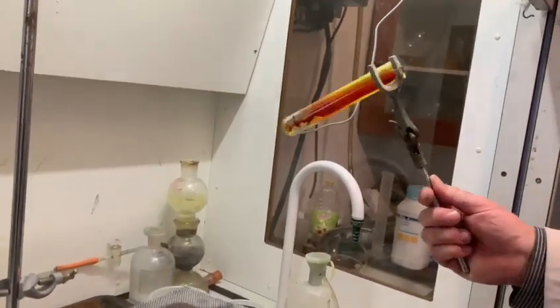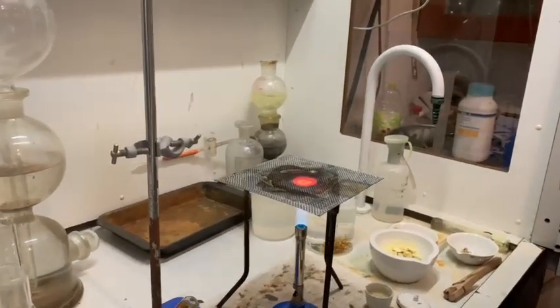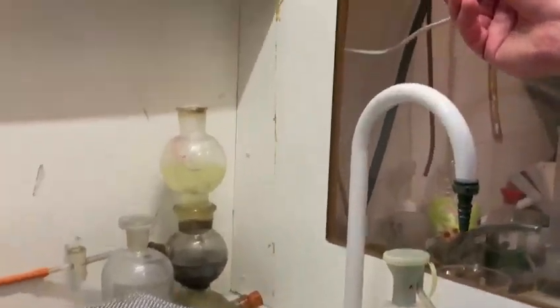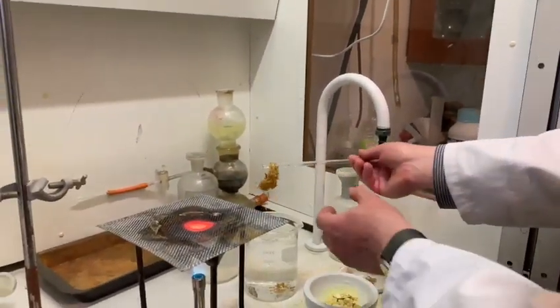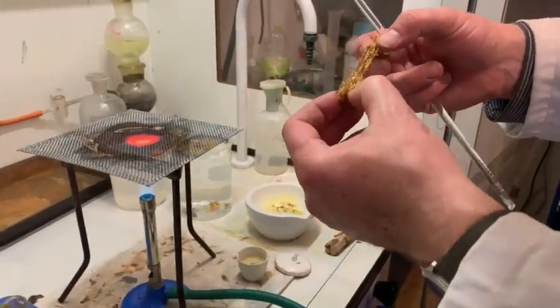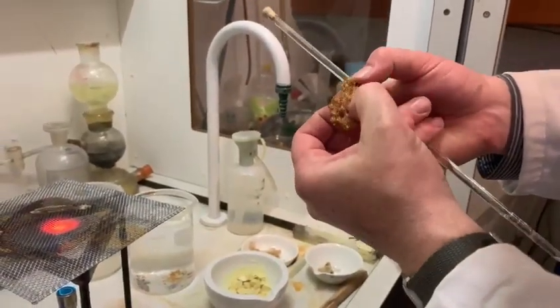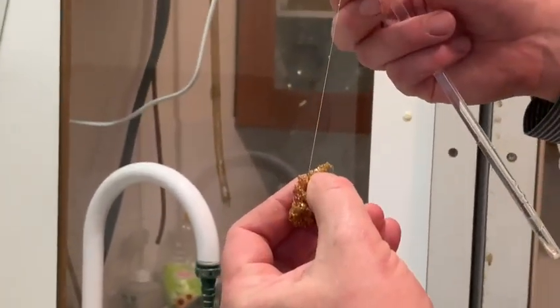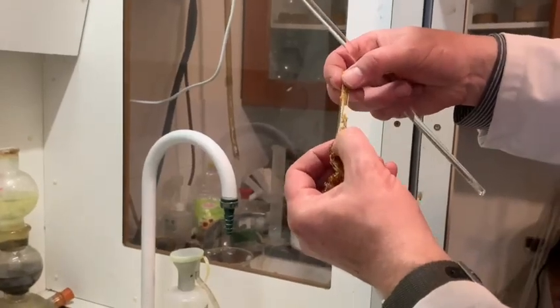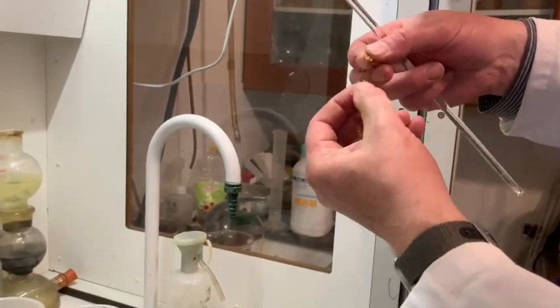Very beautiful colour. I'm going to reach over for a glass rod and begin to pull this out and see what it is. Here we have an entirely different allotropic form of sulfur known as plastic sulfur. It should have cooled down enough for me to pull it apart. It's plastic sulfur because all the molecules of sulfur have been able to stretch, and you can see it can stretch into little fibers.